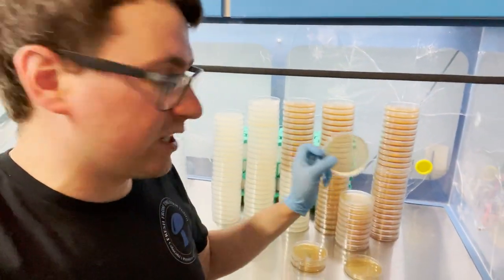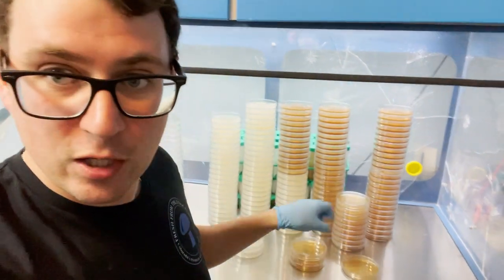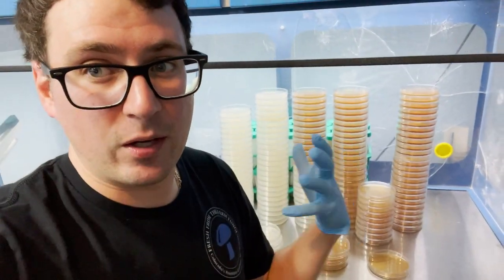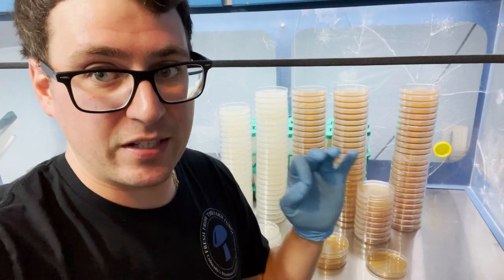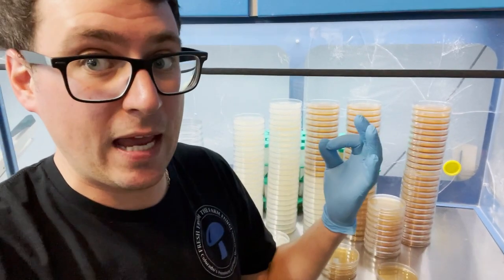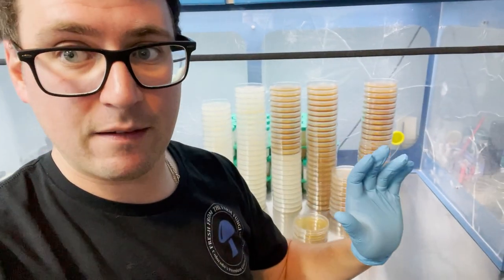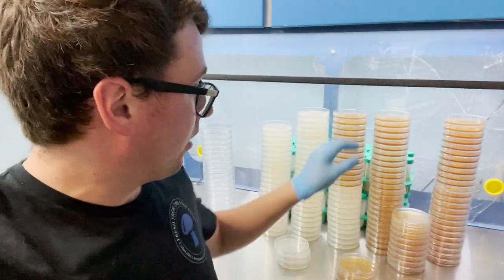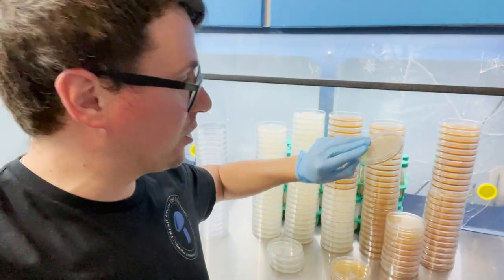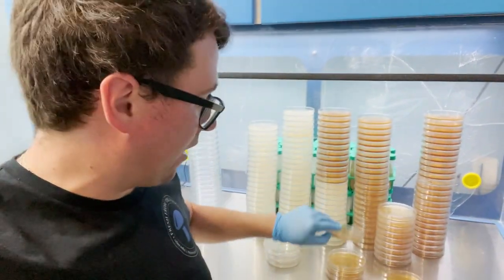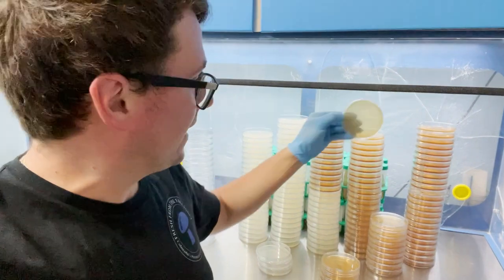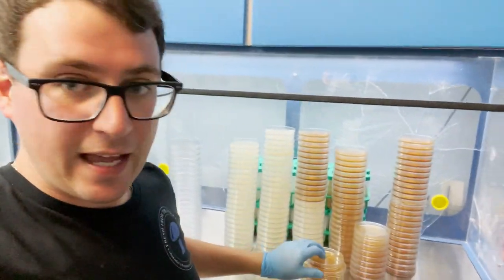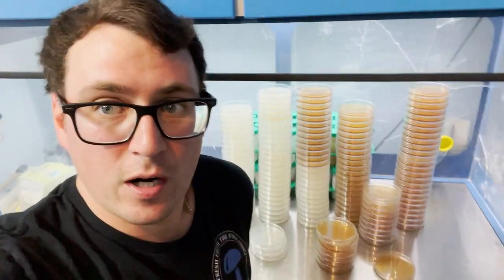So it's just as simple as cleaning out all of your components really well while you're doing the process. You got to have attention to detail and just be patient. Don't use these plates before they sit for four days, or you could end up with a huge lot of contamination that you're not catching. But I know now that these have been sitting out for some time that all these plates are sterile, and I'll go ahead and move forward with my production.